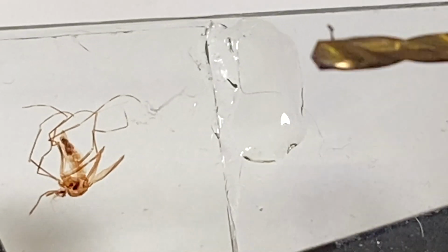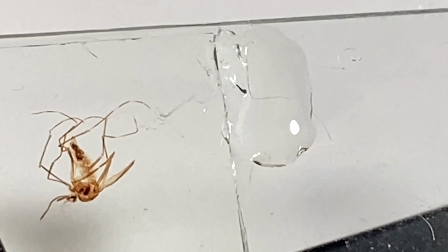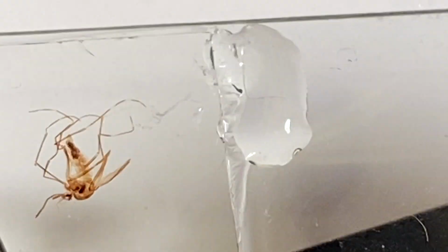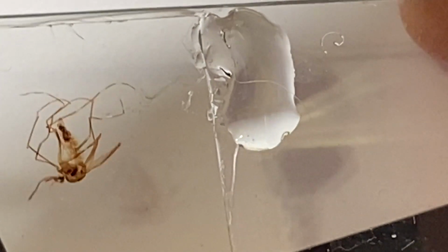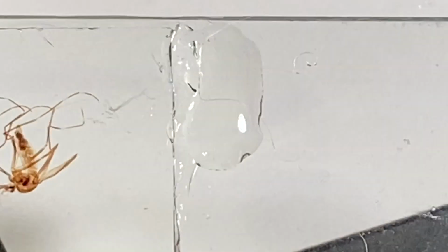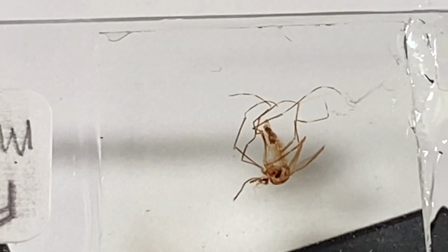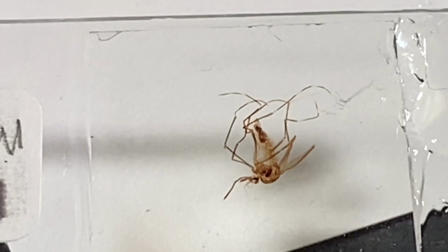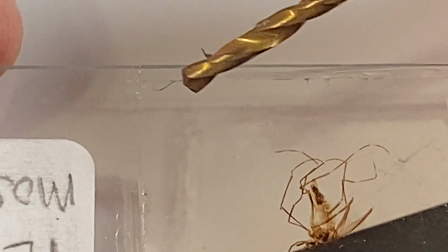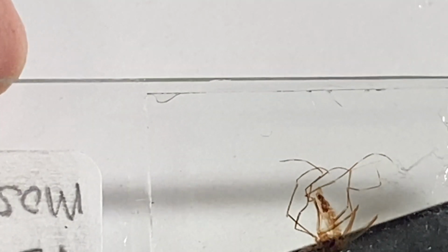Give it a sufficient amount of time to dry, however much time it is. I usually give it at least 2 or 3 days if something's on the side. If it's on top, I give it a lot more time, sometimes a week, even up to a month, because if I apply pressure to the top of the slide, it will sometimes cause more problems than it's worth. So I notice over here, see there's a bubble showing over there. I'm just going to leave that. That doesn't bother me. So that's enough for this video.